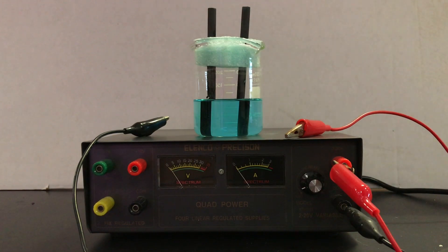Notice I don't have exactly one amp, but I can stop and look back at the video per minute and get an average amperage over the time period.